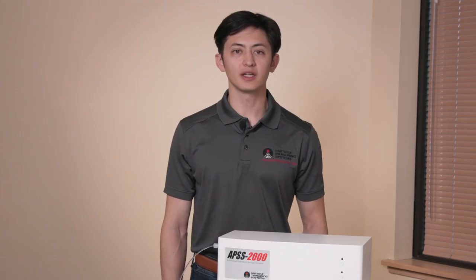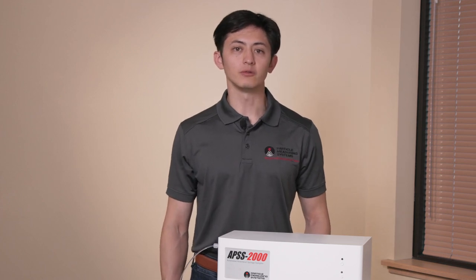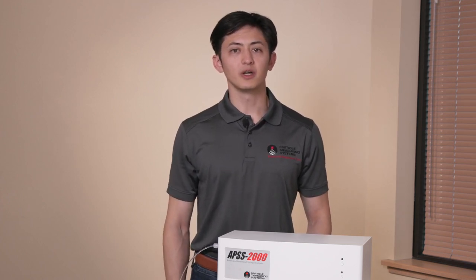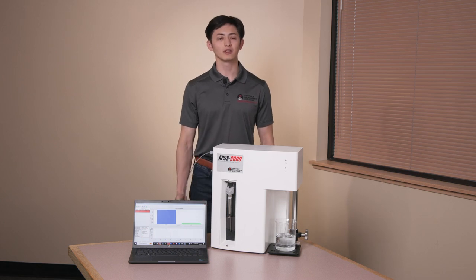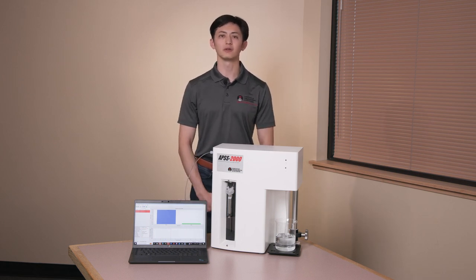SamplerSight is utilized to take samples, to view and export data, as well as to calibrate the instrument. For a full demonstration of our software, please refer to the SamplerSight video series.